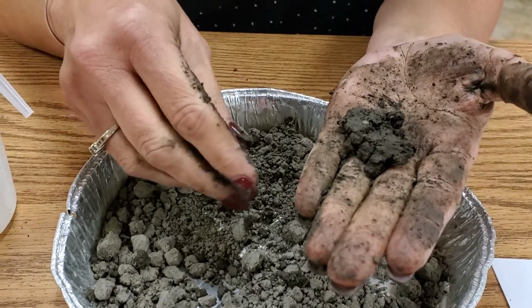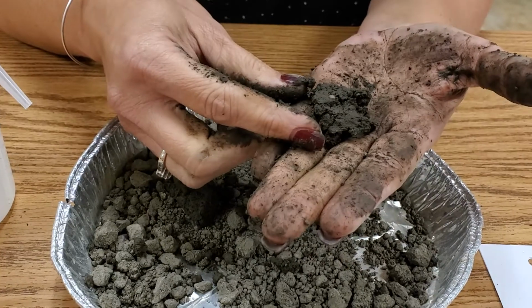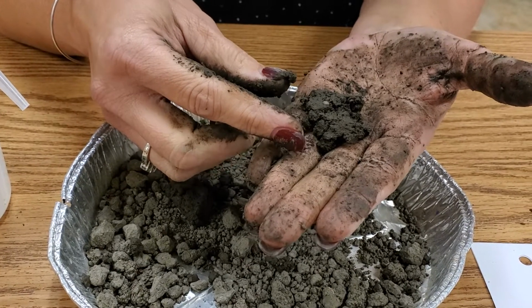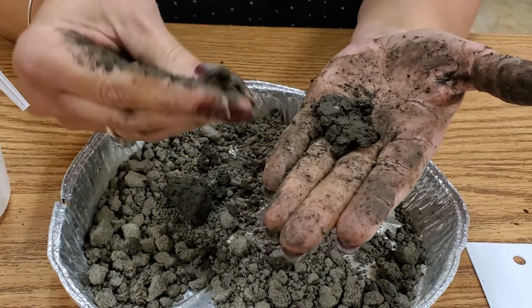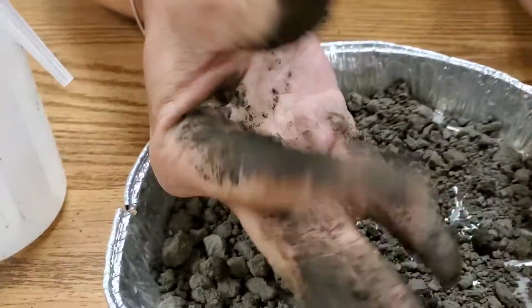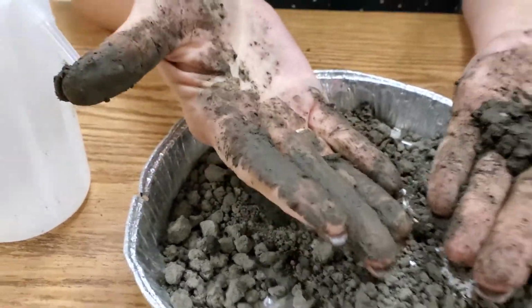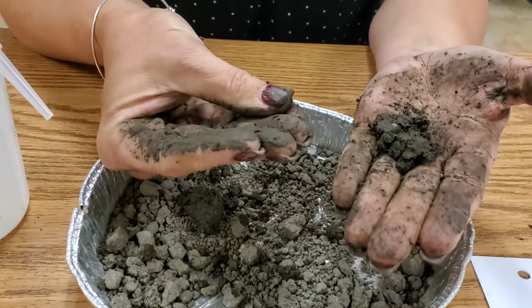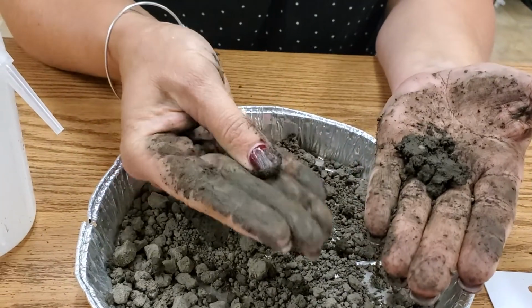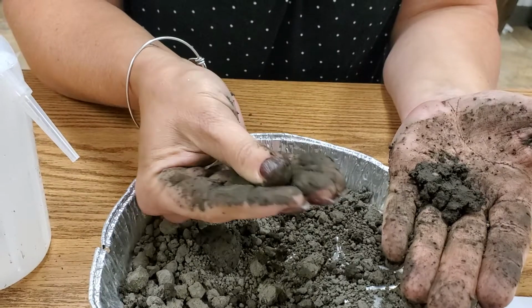So if you read down on your lab and it gets to number 8, it says if you're able to make a ribbon that's 1 to 2 inches long and has a gritty feel, it's a sandy clay loam. This is not necessarily soft, but it's sticky and it breaks down all over your hands. It has the consistency of modeling clay, or like a nice face mask, as you rub it across your hands. I don't feel any grittiness whatsoever.